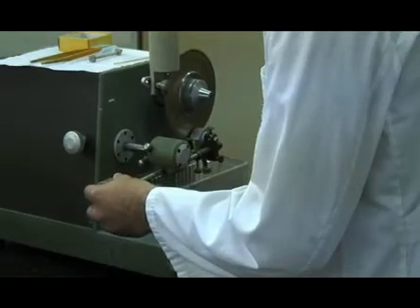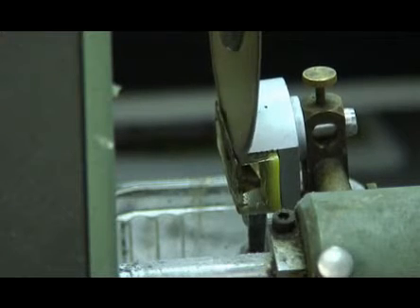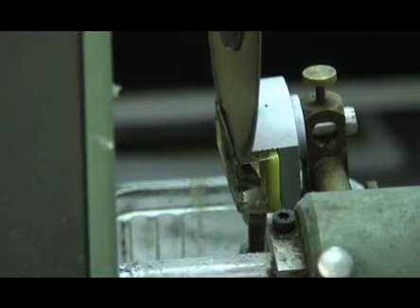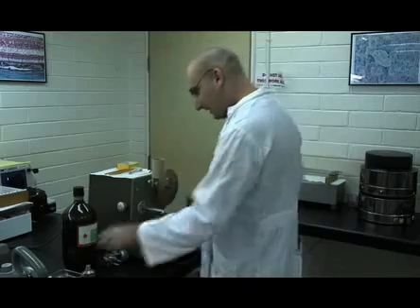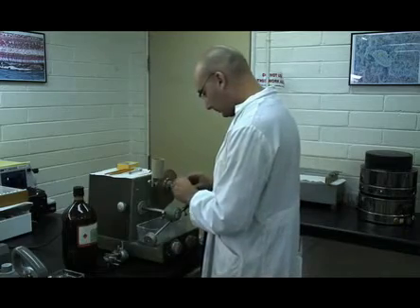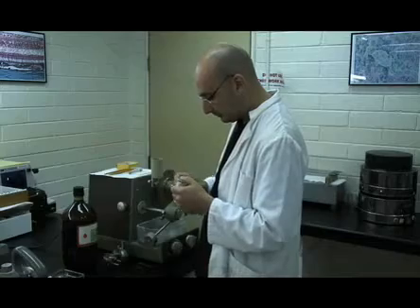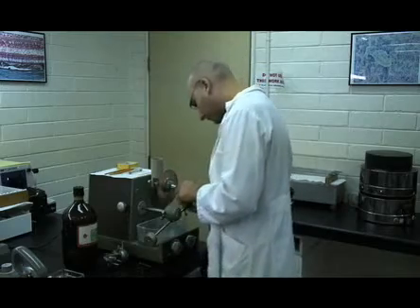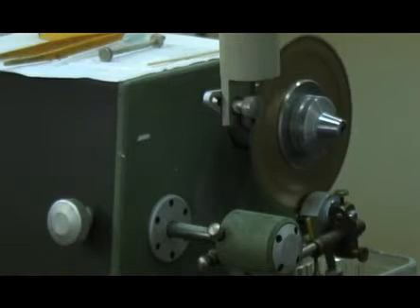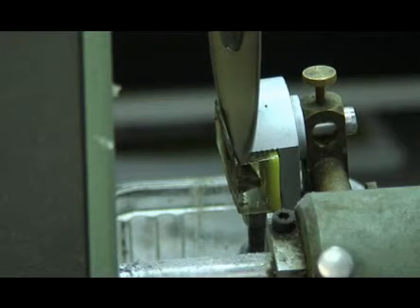Ground sectioning produces larger sections between 20 to 50 microns in thickness. It is useful for fluorochrome analysis as thicker sections produce brighter fluorescence. To produce the ground section a macrotome is needed, preferably with a diamond blade. We use a 0.6 millimeter kerf diamond blade. A lubricant is imperative; we prefer a petroleum based lubricant although silicon based lubricants also work well. The block is then placed in the clamp, secured into the macrotome, and the block is advanced towards the blade. The first section exposes the cutting face and orientates the section — it should be discarded. Grinding is a slow process and should not be rushed, and adequate lubrication should be ensured.